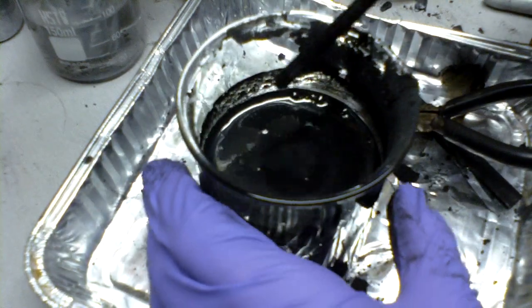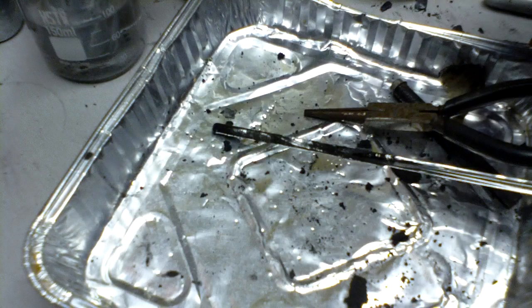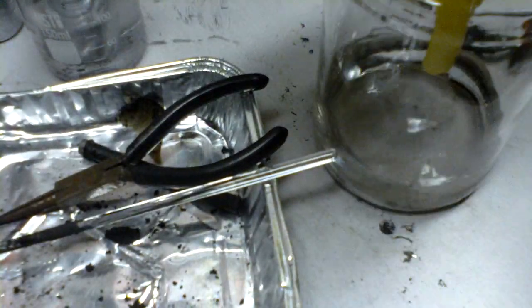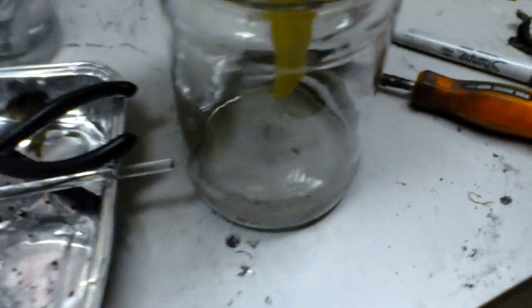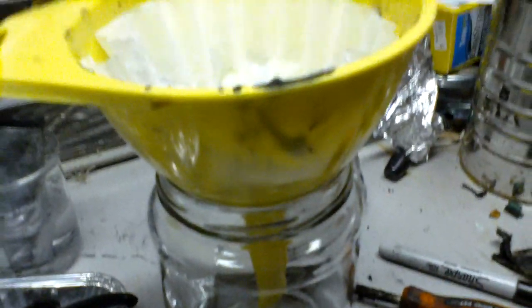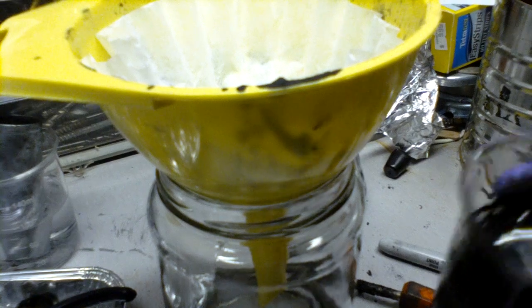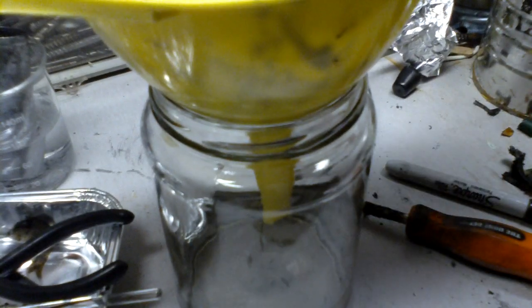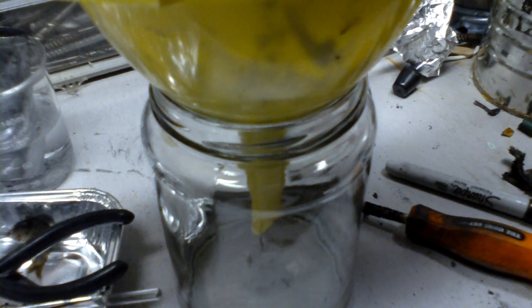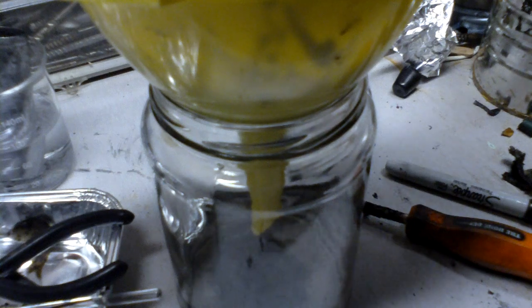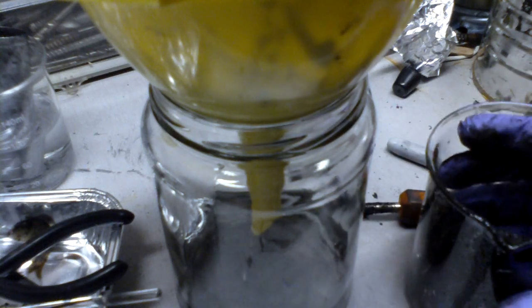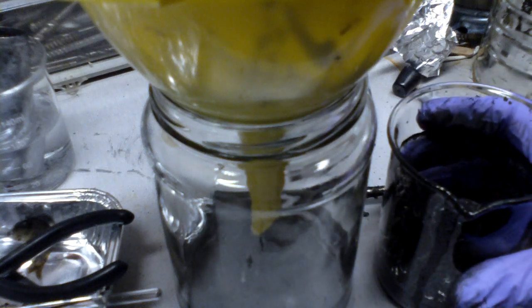Okay, all of the chemicals have to be dissolved out of it, and now get ready to filter it. I'm pouring this into a coffee filter which I've done this before with. So that's why there's already water in the bottom. Doesn't really matter.